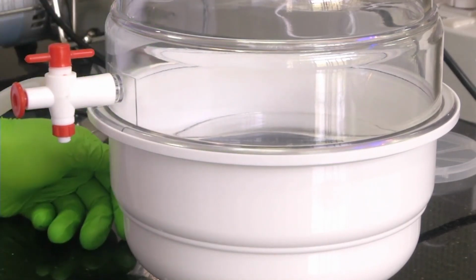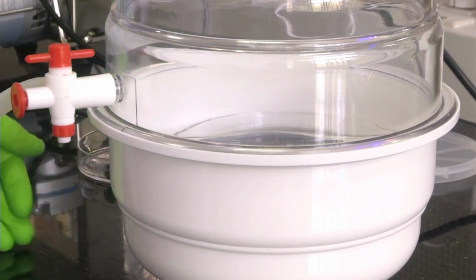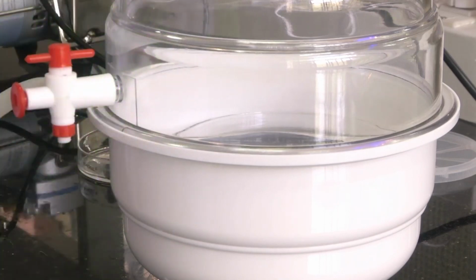Like last time there were millions of air bubbles actually inside. Now it is a few hundred. So these air bubbles won't take much time to clear. Maybe around 5 minutes it will take, and these air bubbles will get cleared, and again we will get a very clear solution on top of the silicon mold.